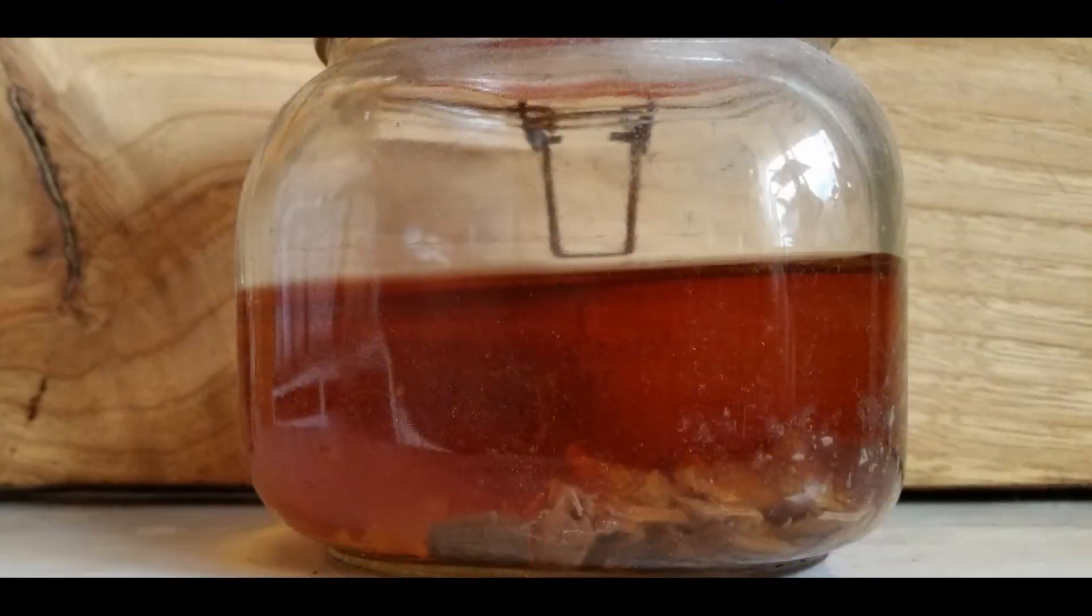Look at what happens with this. It's oak. The tannins in the oak are being extracted, and therefore the originally clear ethanol has turned that caramel colour.